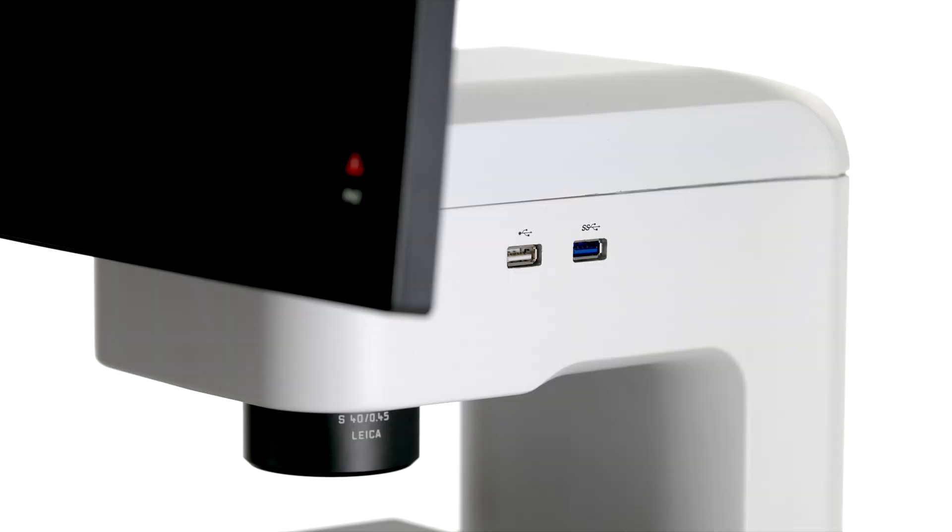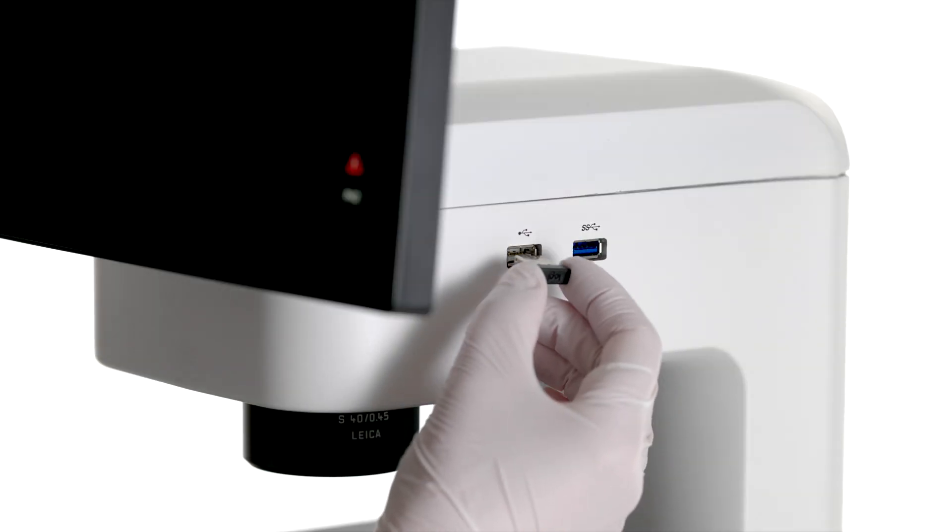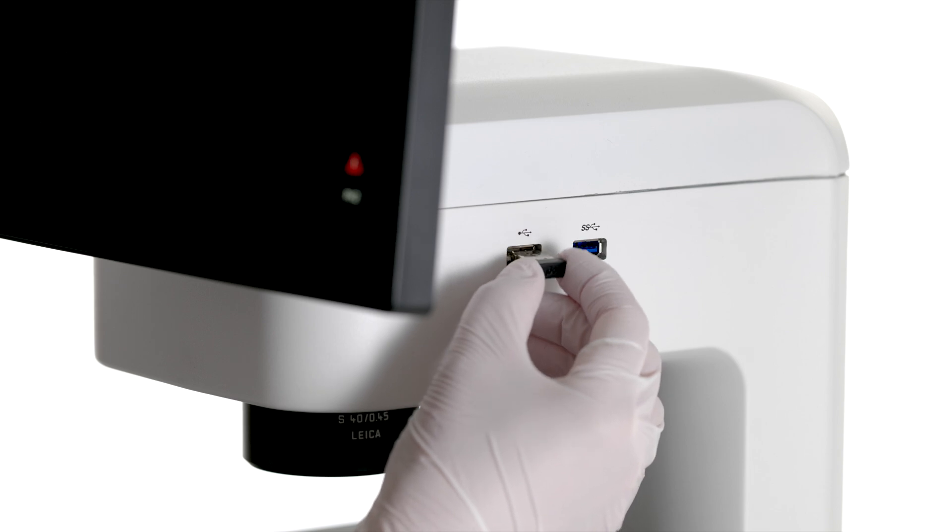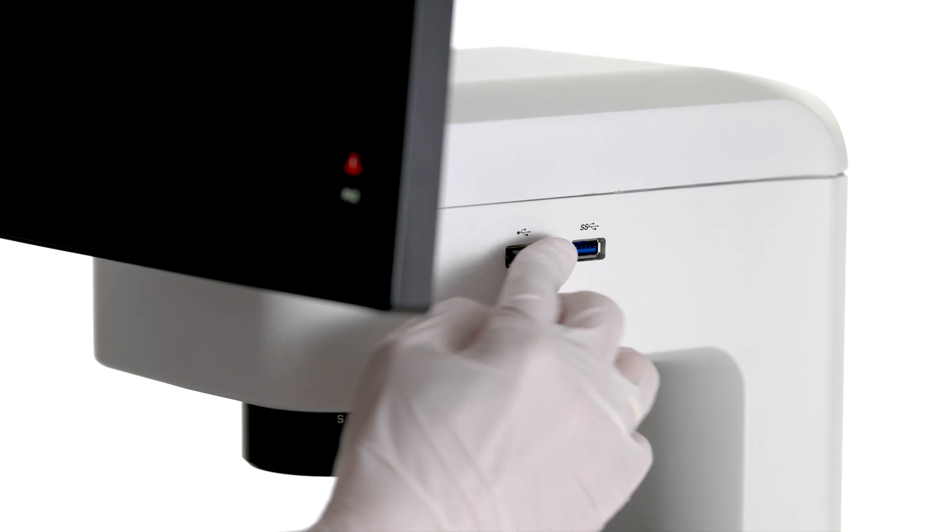Now you can install the mouse. All you have to do is plug the Bluetooth USB stick into the port located on the right-hand side of the device.